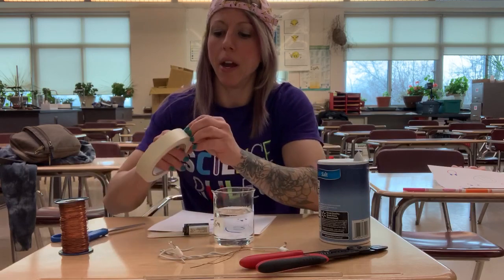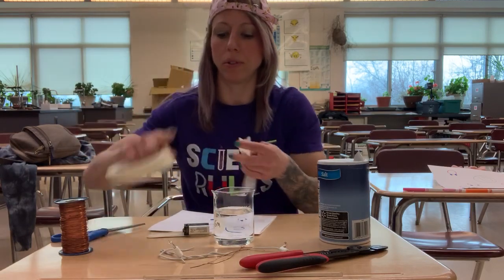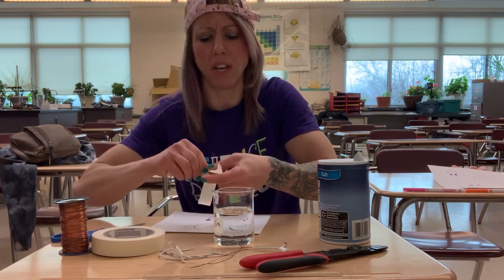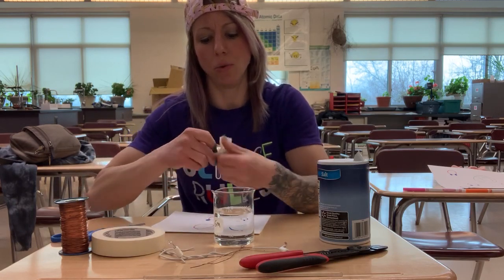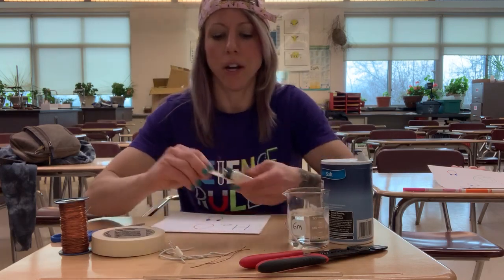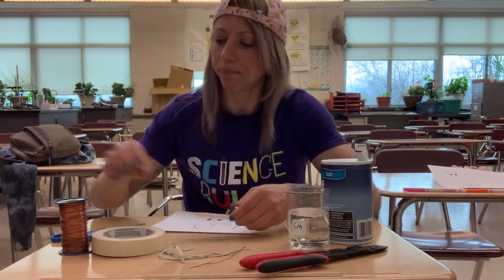Now I'm gonna tape my 9-volt battery to the popsicle sticks. And I'm gonna try to do this really quickly to get to the point here. You could make yours look as nice as you want. So this one's gonna be a little bit rough looking, but you get the point. All right, so I've taped my 9-volt battery here.